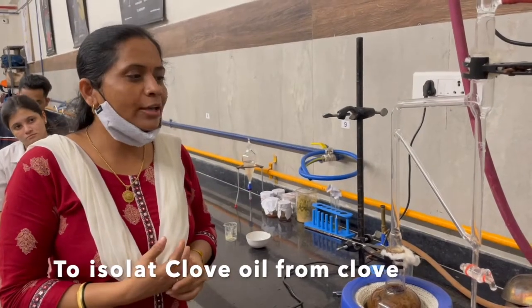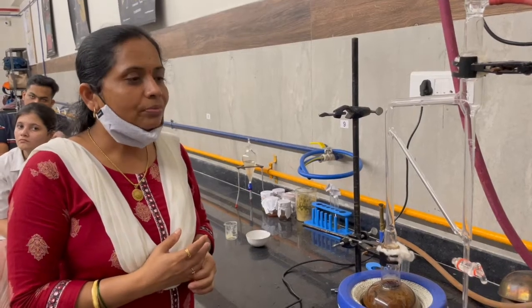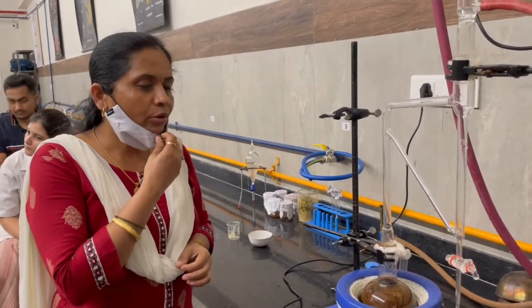The aim of today's practical is to isolate or distill clove oil from clove powder drug.